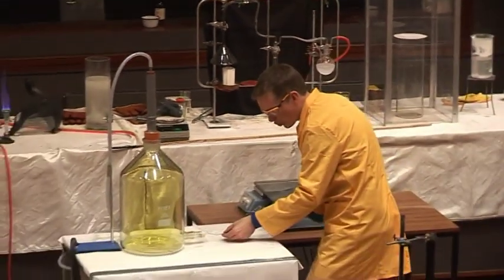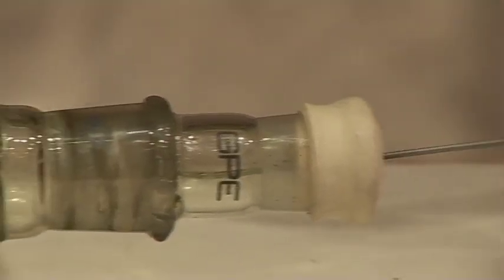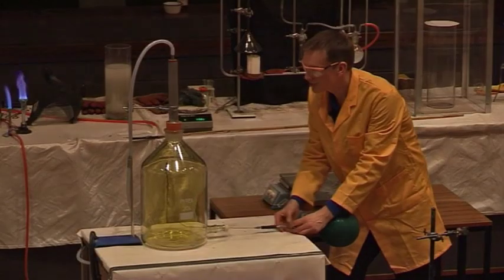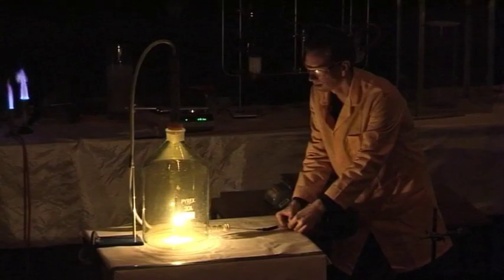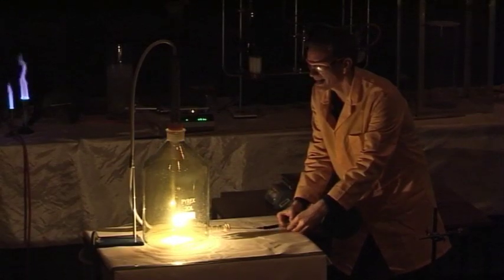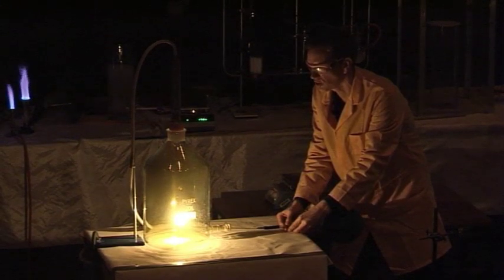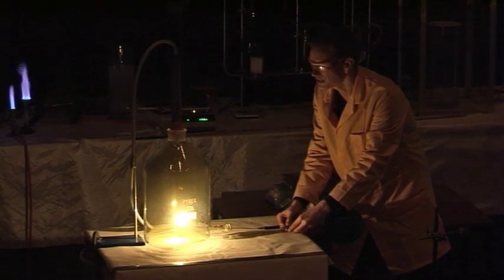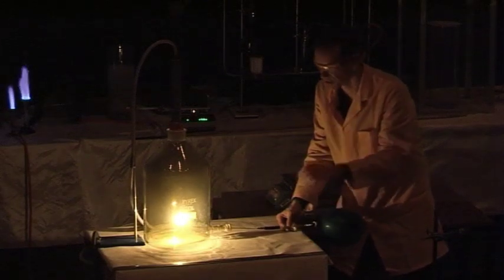I'm going to put this into the chlorine — there's no oxygen at all in this. I'm going to turn the tap any second and watch what happens. There we are. As soon as the gases mix, as soon as the acetylene comes into contact with the chlorine, we instantly get a reaction. It's burning, so there's no oxygen in this reaction.